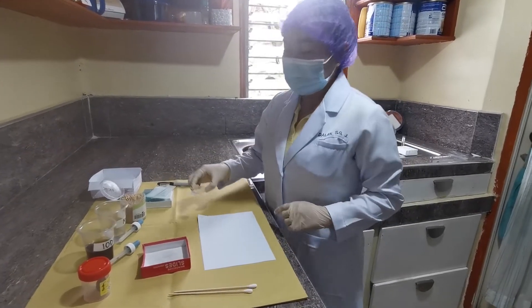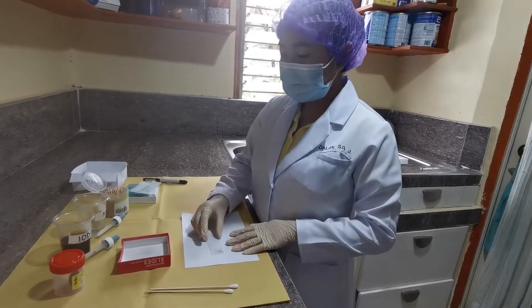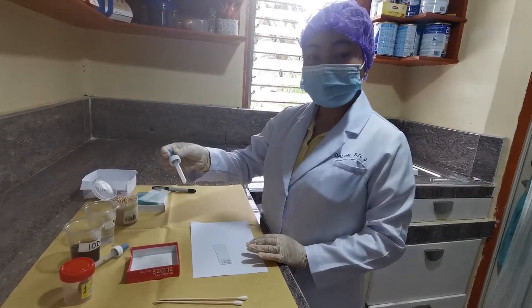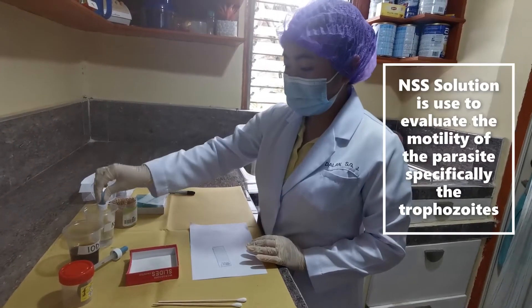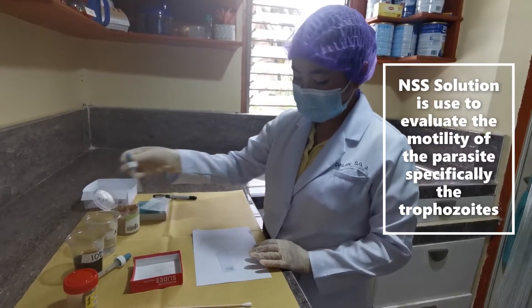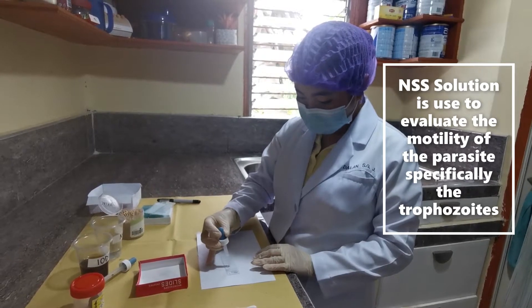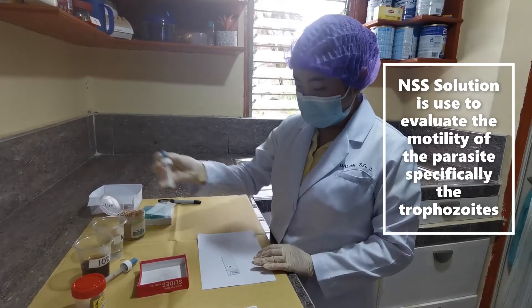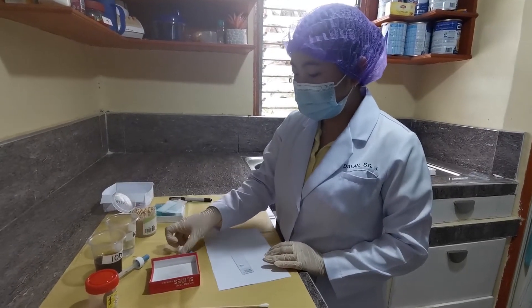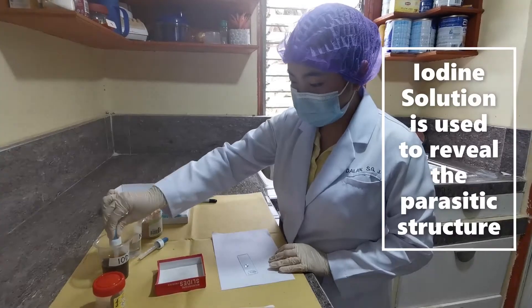So to start with, in a clean labeled glass slide, we are going to add one drop of the NSS solution and one drop of the iodine solution.